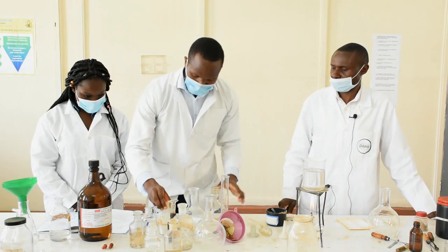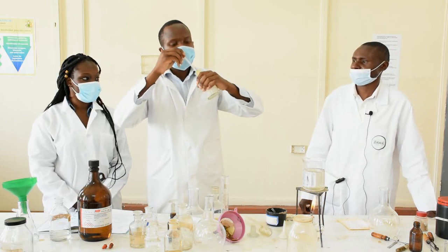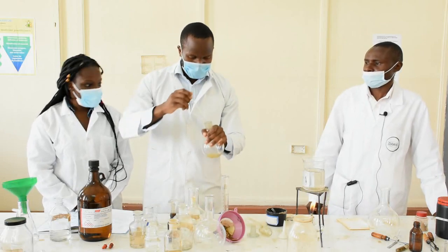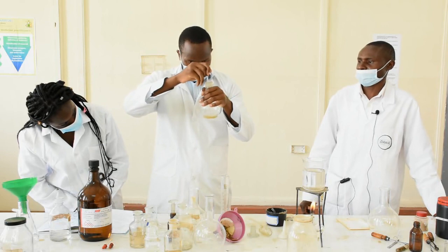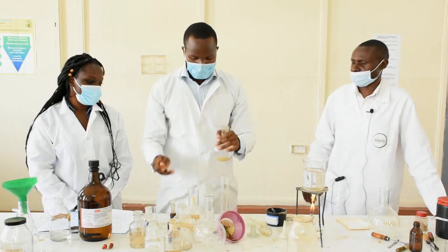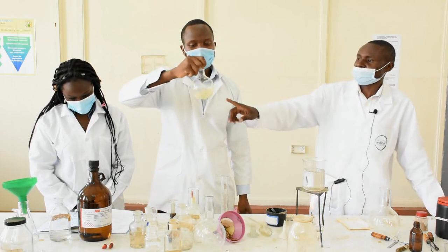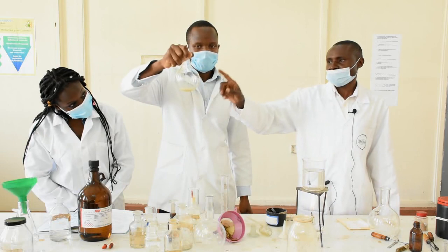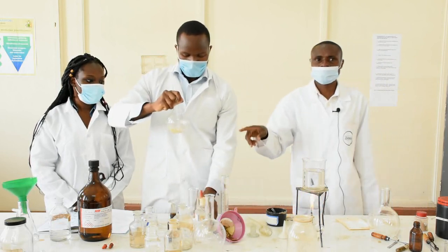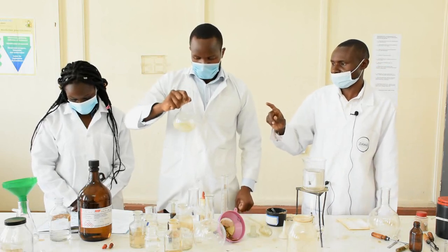Put the filtrate into the separating funnel. The next step is to extract successively using chloroform — measure 2 ml and add to the separating funnel. Shake the funnel. The solution becomes turbid initially. Notice our solution is turbid, meaning a reaction is occurring.